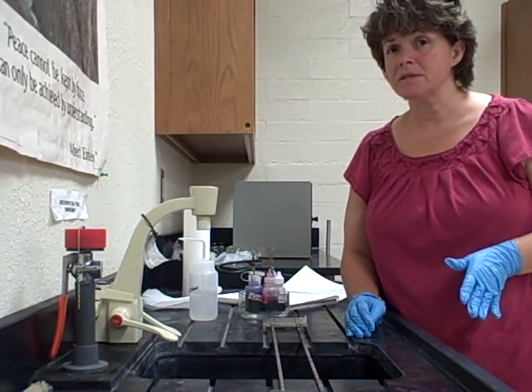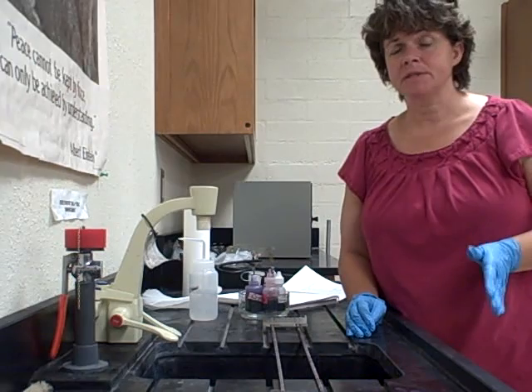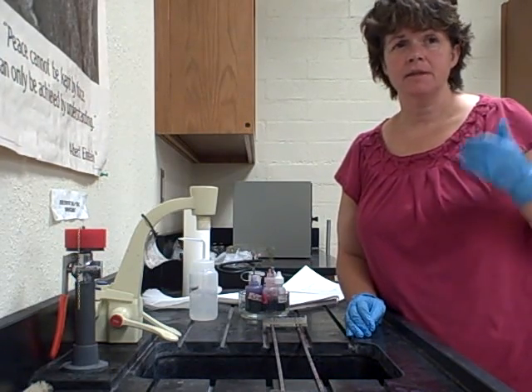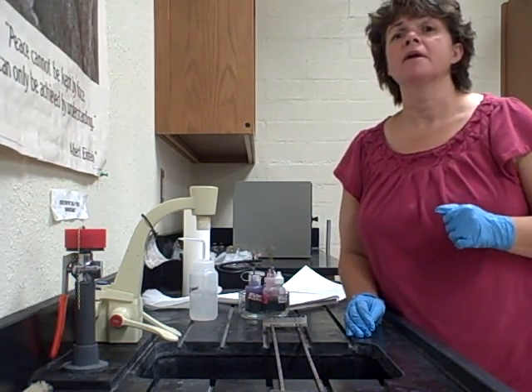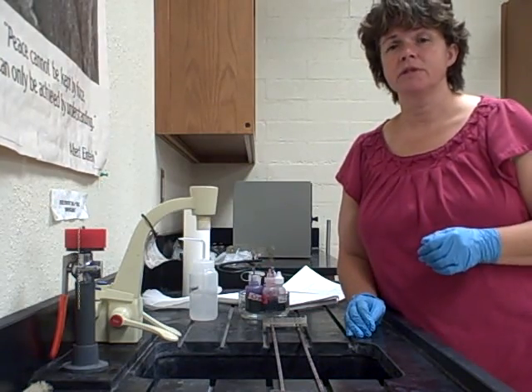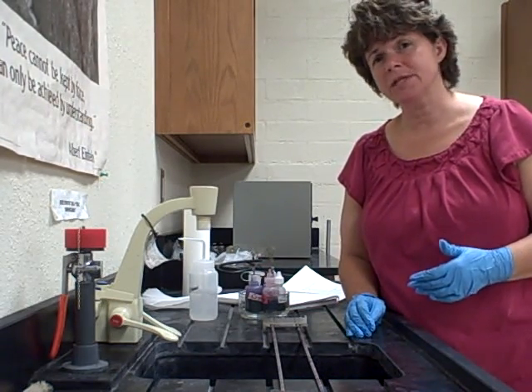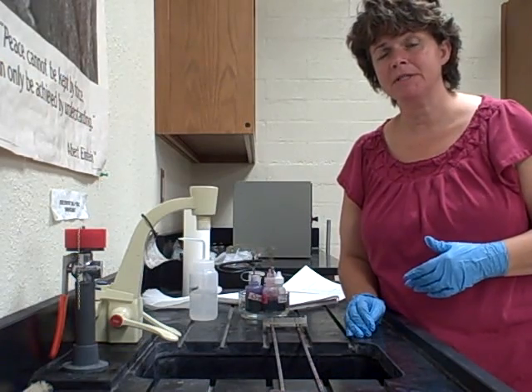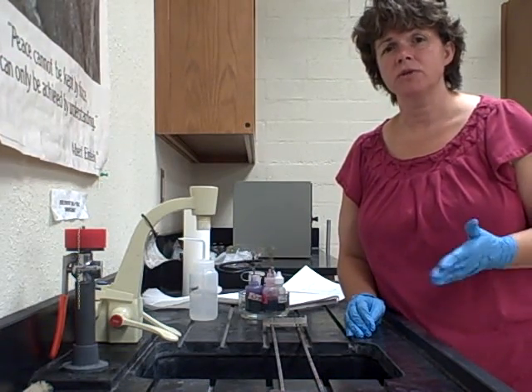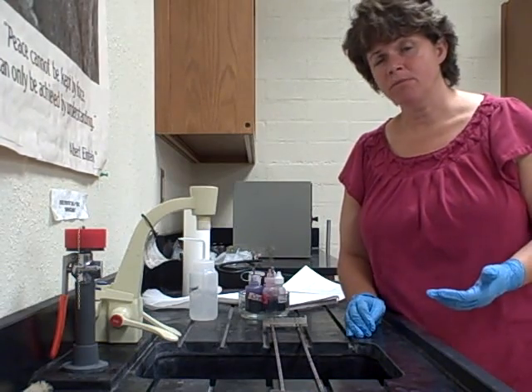This is one of the most important stains. When a doctor suspects a bacterial infection — say in the lungs or in the blood — he's going to send a sample to the lab, and the lab is going to do a differential stain, a gram stain. It takes maybe about 10 minutes to get a result, so you can quickly distinguish between the two.